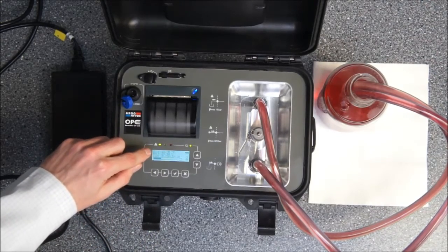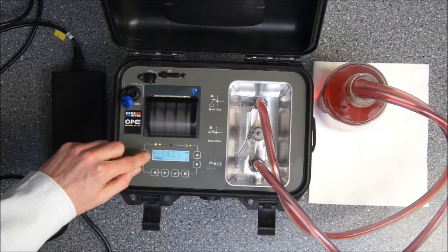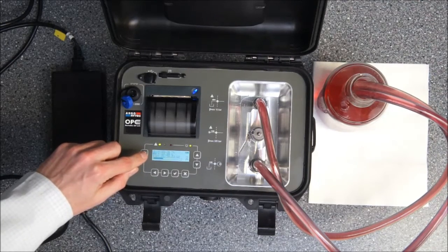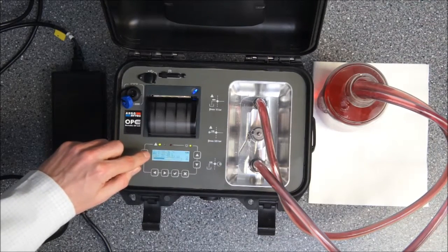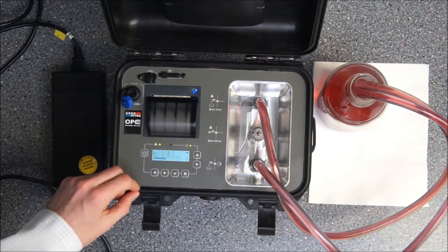You see first line the temperature, second line the relative humidity which is showing the saturation value of the oil according to water. Third line is the ISO reading.